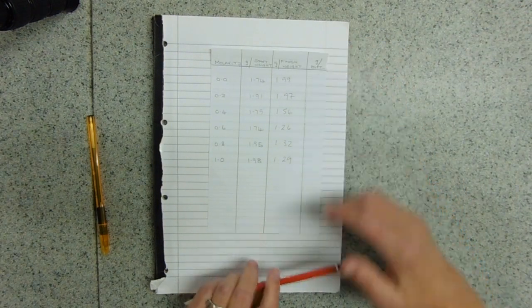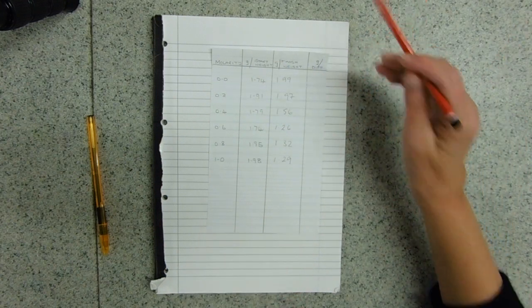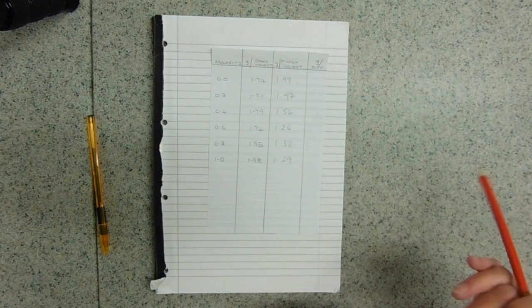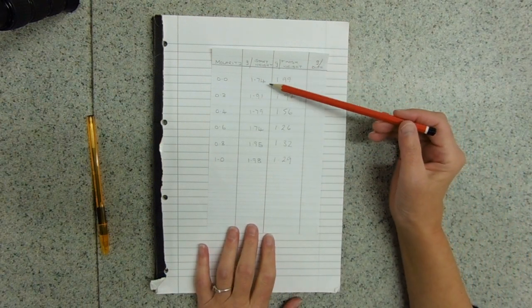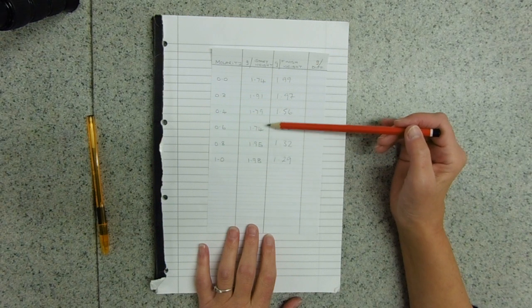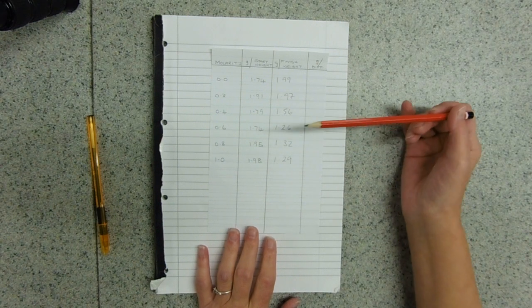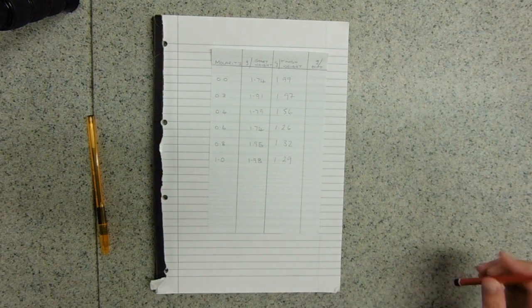So this is the results table for the potato osmosis experiment. These are my raw results where I've just jotted down the molarity, start and finish weight, and the difference. I'm going to need to do a percentage difference in mass because each one of these has different starting masses.